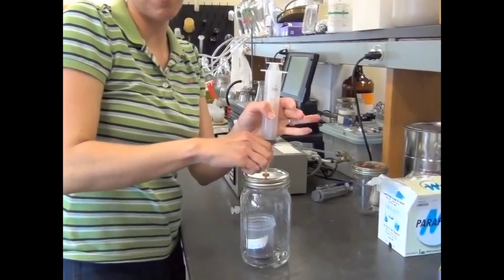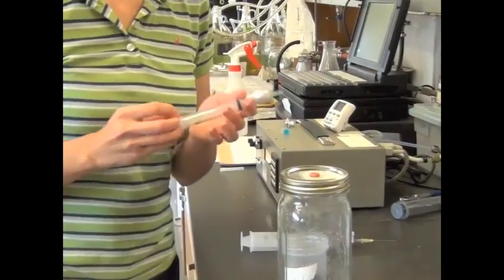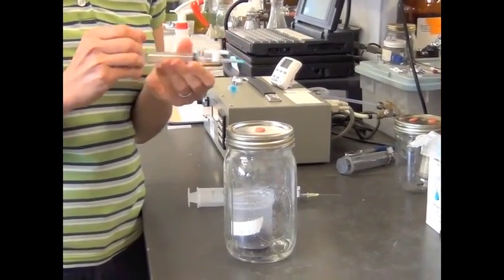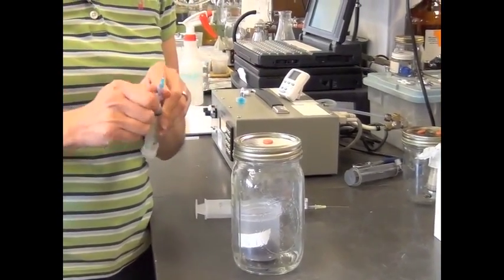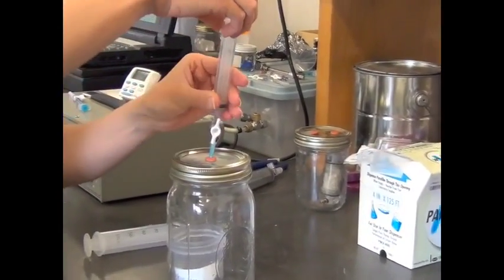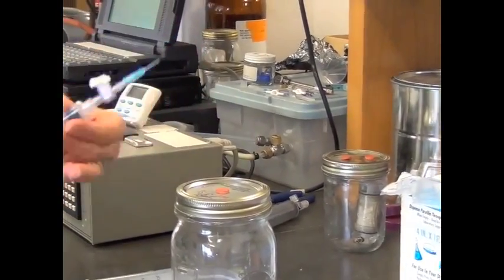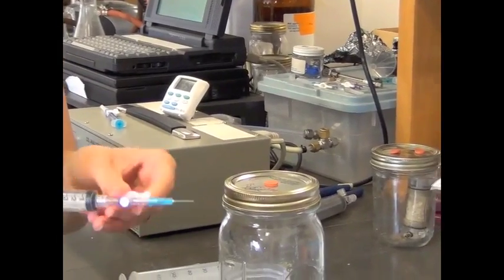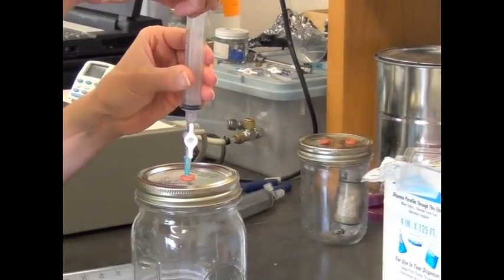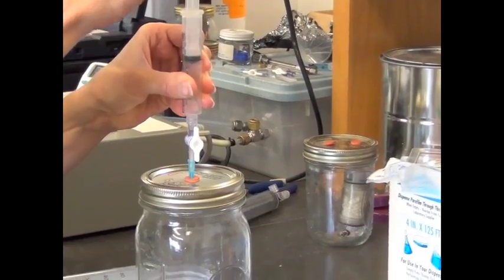Okay, now that we have the sample mixed, we'll take our actual gas sample to put into the infrared gas analyzer. So we're going to use this 10 ml syringe to do our time zero measurement. First thing we need to do is flush the syringe with room air. We'll close the stopcock here, put the syringe in the jar, open the stopcock, and pull out a small amount of sample. And this is just going to flush the head space of our needle. Now we're still going to want to flush with this syringe a couple times before we take the actual sample.